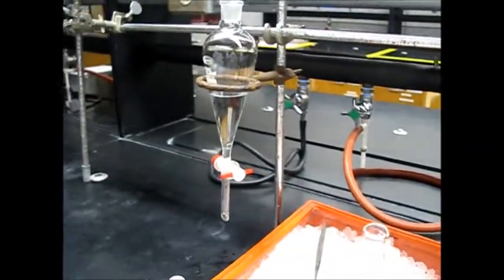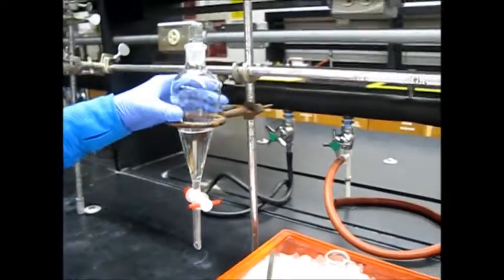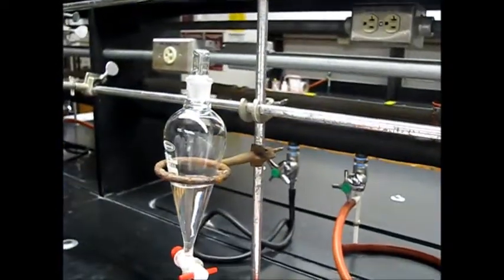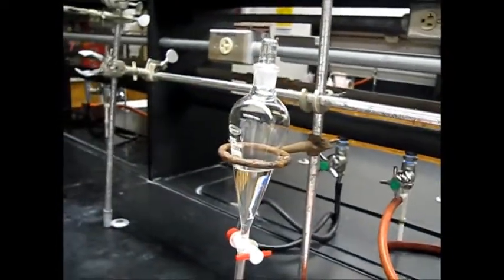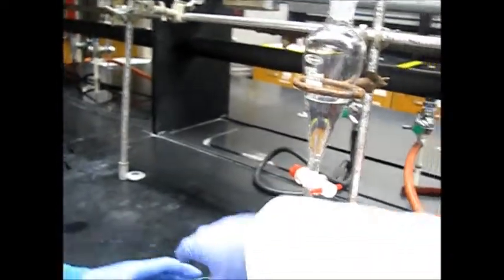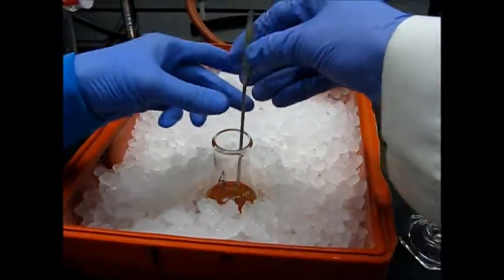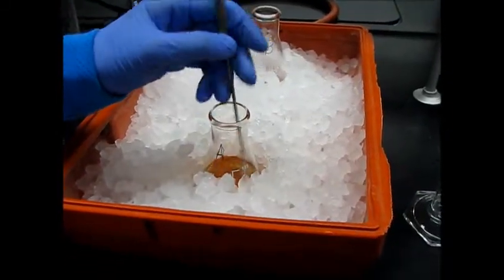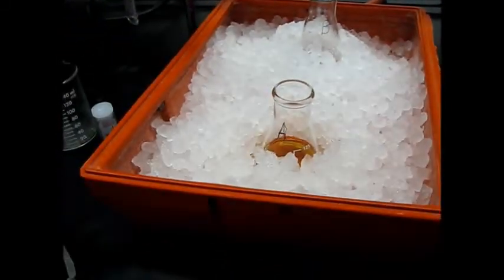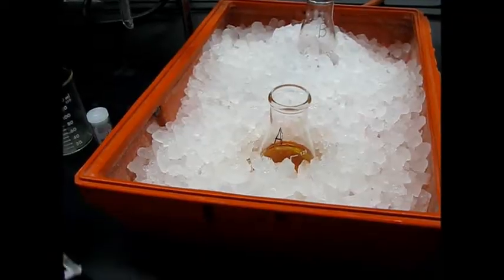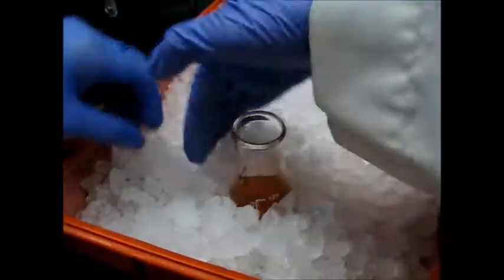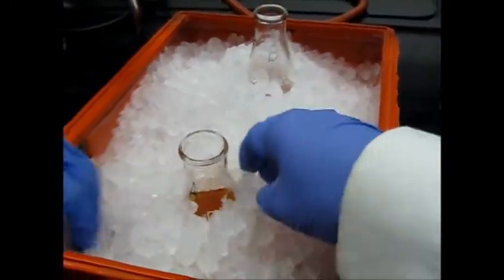Meanwhile, we can start washing our glassware. We can throw this ether layer. Let's test this first. Blue. Basic. So we will wait for it to cool and the precipitate will form.